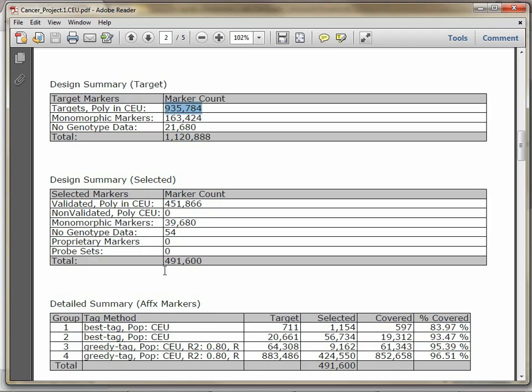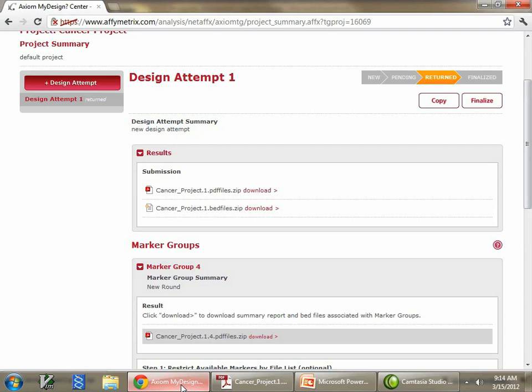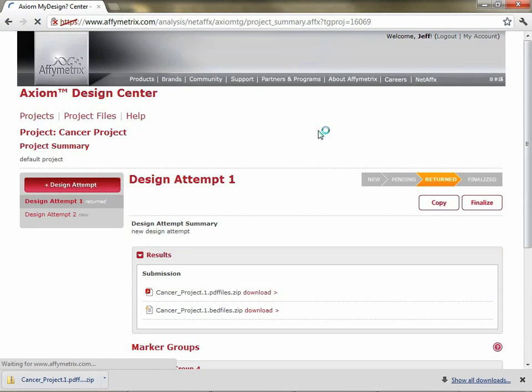So I'll return to the design attempt to show you the easy ways that we've facilitated this. Here we are back at our design attempt, and you can see up here underneath the status there's a button called Copy. If you select Copy, a duplicate of this project will be made, but the one that was submitted and returned is not editable. The copy will now be editable.